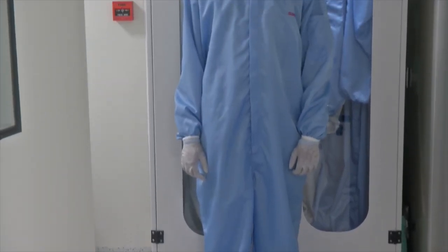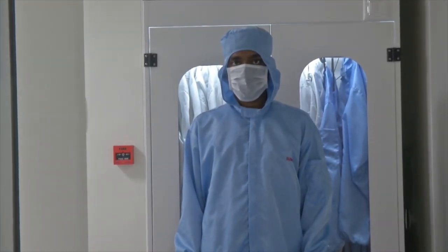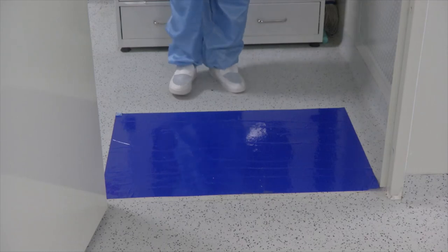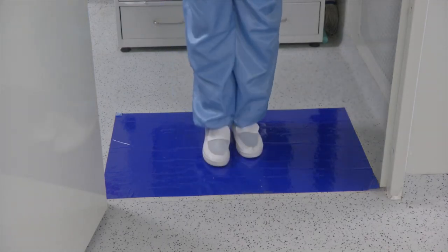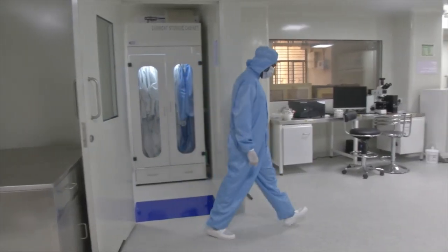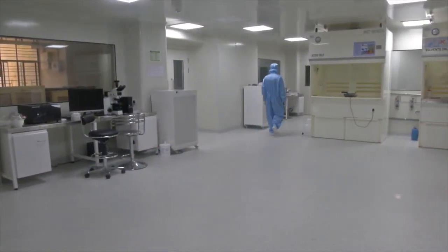This is how clean room entry is made. The final step before one enters the clean room is to step on a sticky mat. This mat is placed dedicatedly at that particular spot just before entering the clean room, so that whatever dust particles are on the shoes are taken care of.